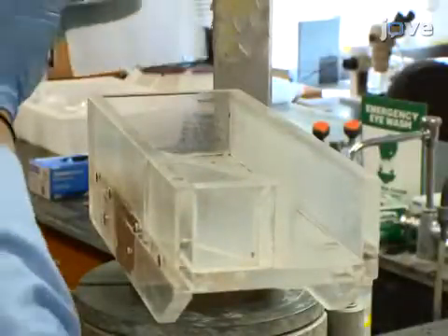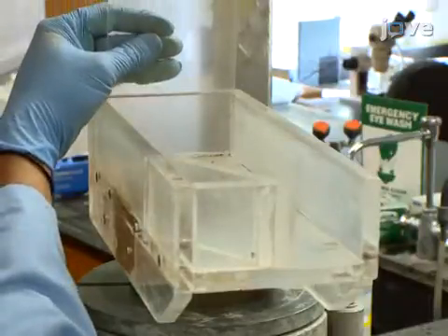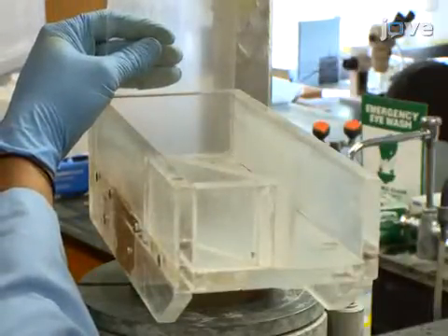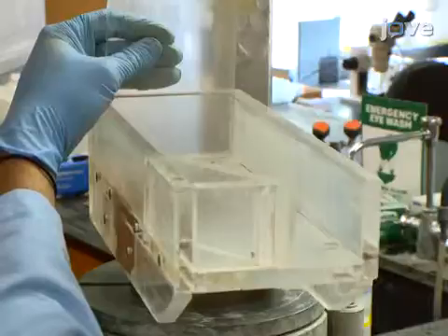A full piston rotation moves the collar 2 mm. The rig is outfitted with an acrylic plate that has an inner diameter of the sampling collar. Use this plate to make the initial sample cut.